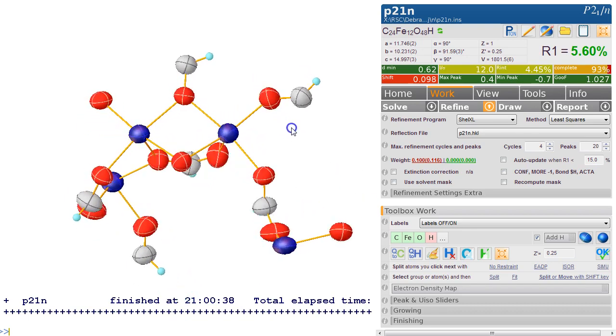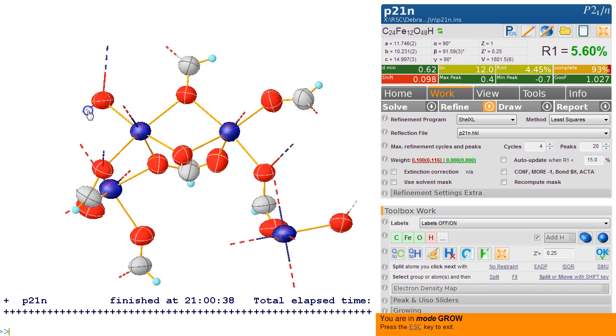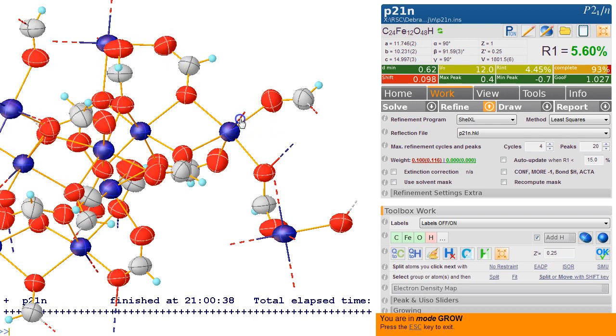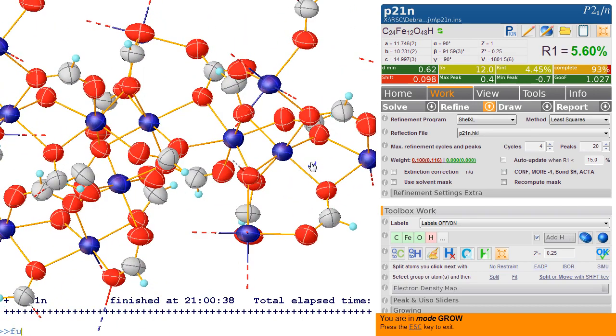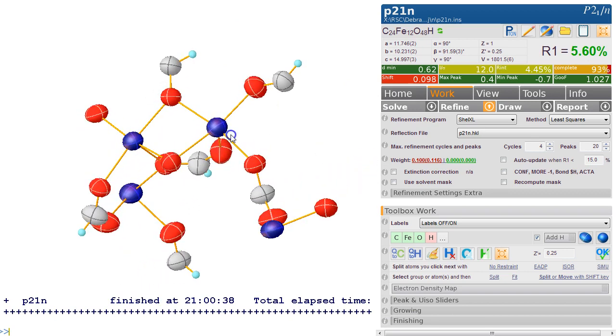So what we now can do is, if this oxygen sits here, when we press Control G, we will see this grow. So if we keep growing on these bonds, this is like a polymeric network, and it keeps going and keeps going. So if we type fuse again, we go back to the asymmetric unit, and we might want to tidy this up because this is clearly another one of those formates.